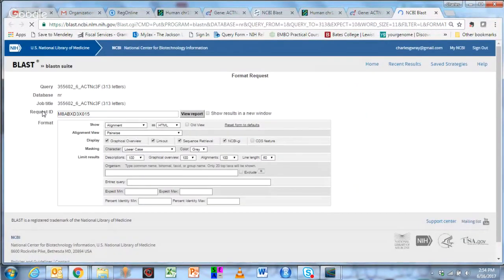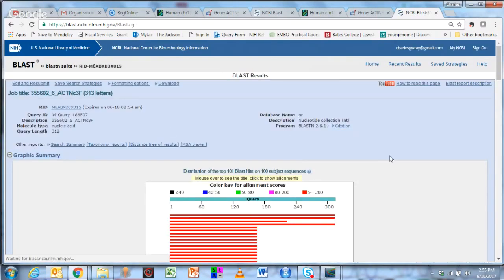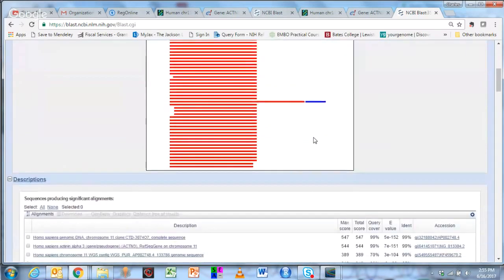It's going to kick you over to the BLAST tool, and it's going to sit here and queue this up and run the BLAST. You can hit this and see how fast it operates. It finished very quickly here. And you can see there are a couple of hits where it aligned almost perfectly all 310 some odd bases.